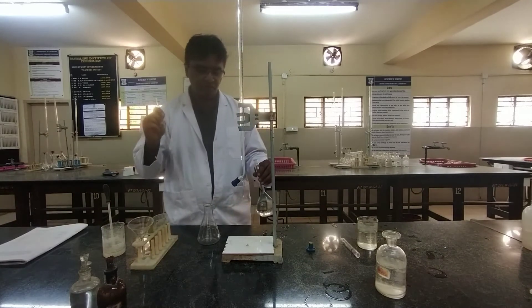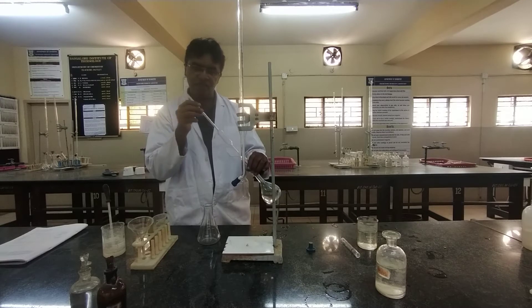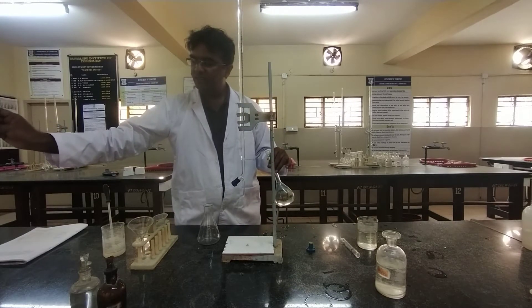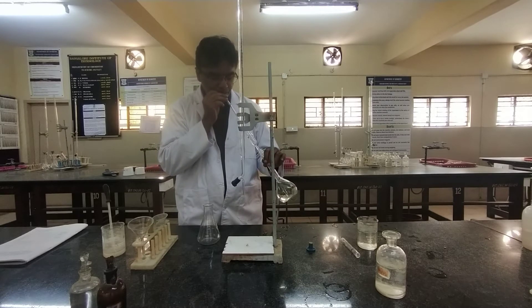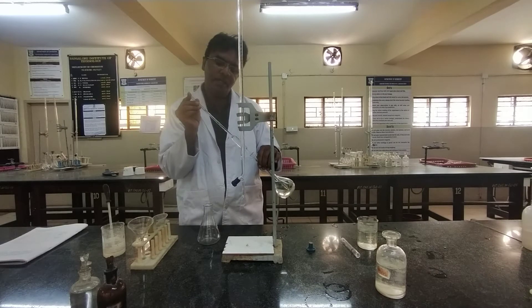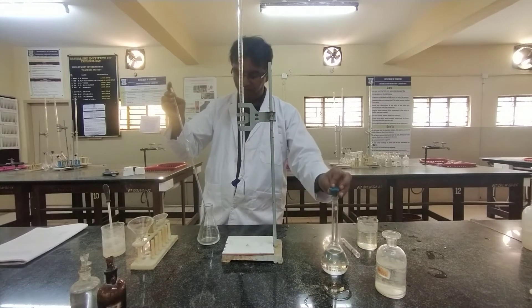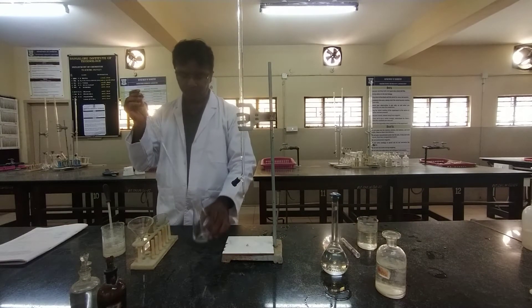First rinse the pipette with water, then rinse the pipette with a small quantity of the brass solution. Then pipette out 25 ml of the brass solution into a clean conical flask.